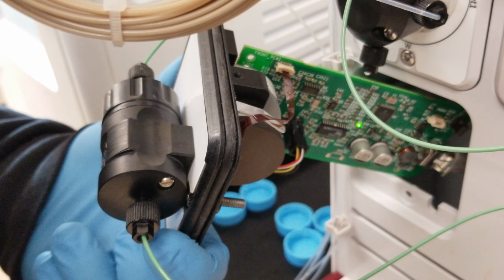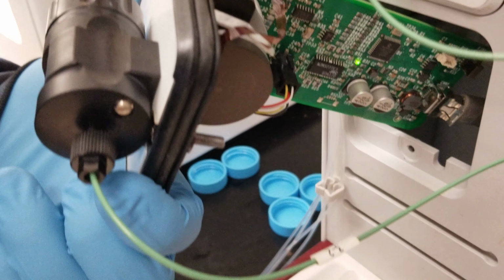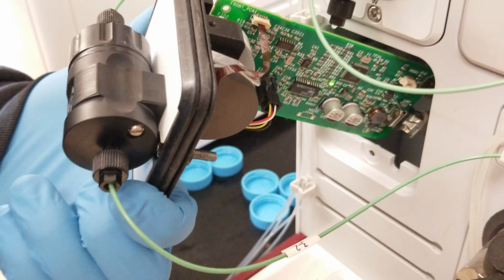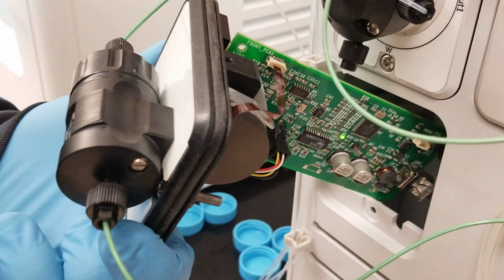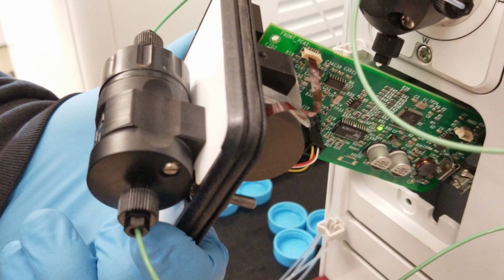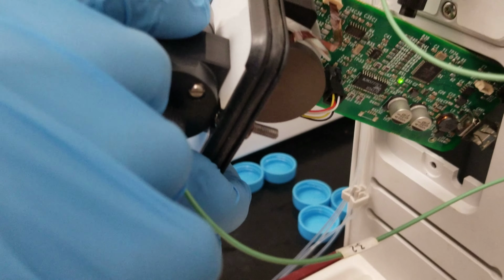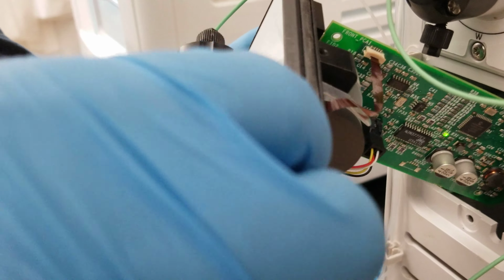Is that the sound? No, this is normal. What if we pause it? Yeah, that's a good idea. Maybe let's pause this. Is it supposed to spin while it's on pause? Maybe that's why it's making noise, because I can feel the magnet moving. But look, it keeps spinning even at pause.